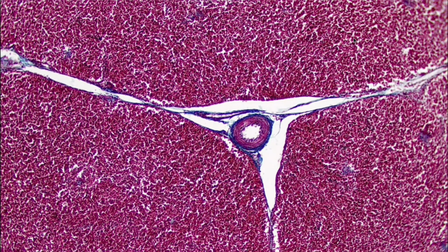Next, this is one that I think a lot of people struggle with sometimes, but this is going to be reticular tissue. One of the main ways that we can tell it's reticular tissue is that we are going to have these really pronounced fibers running all the way through reticular tissue, and we're going to have lots of these little dots scattered all the way around. So we can see these fibers, these little dots.